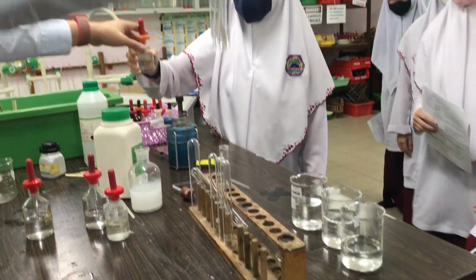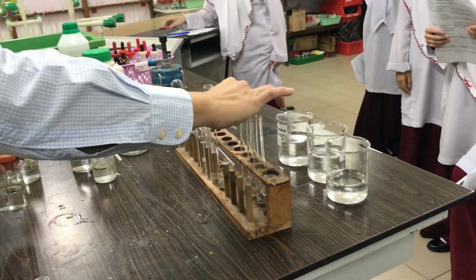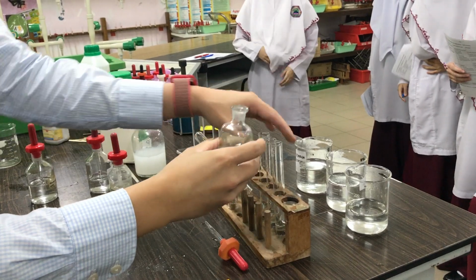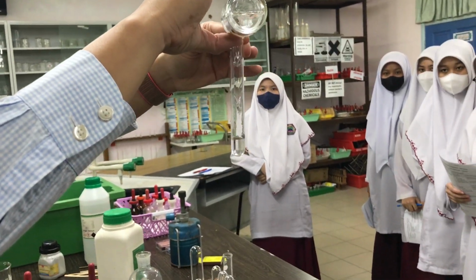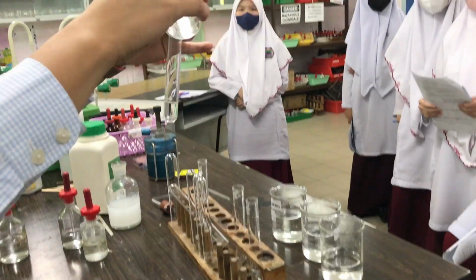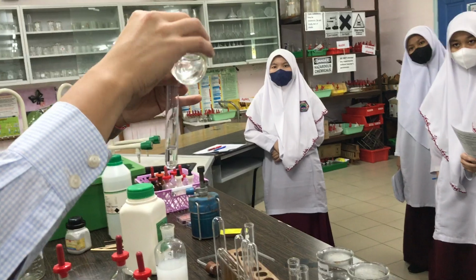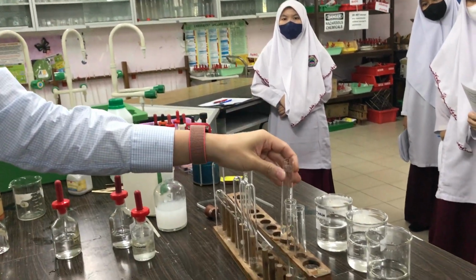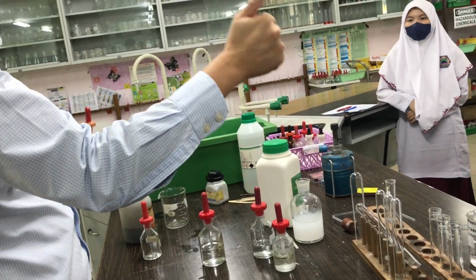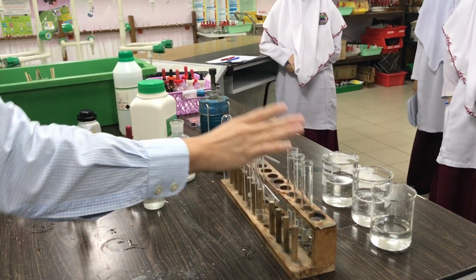Okay. Now, 3 of these are colorless. You don't know which one is which one, right? Well, actually you know because chloride, bromide, iodide in that order, okay? So, watch what happens when I add nitric acid. Anything? No. Nothing, okay? There's meant to be nothing happening, because you haven't added in the second reagent. Adding nitric acid will not do anything, but you must add nitric acid to all 3 of them. Test for chloride, Cl minus, bromide, Br minus, iodide, I minus, add nitric acid.